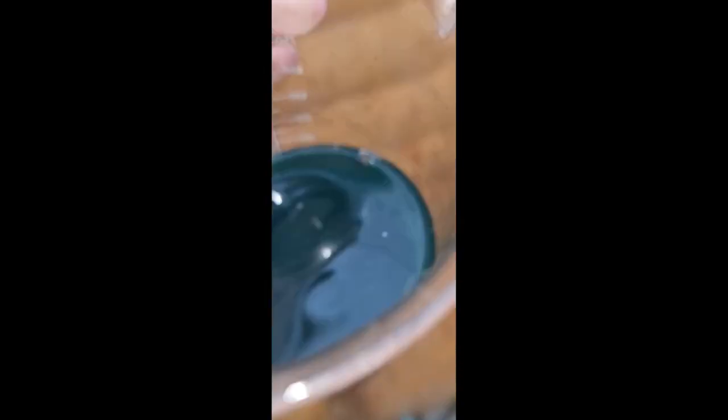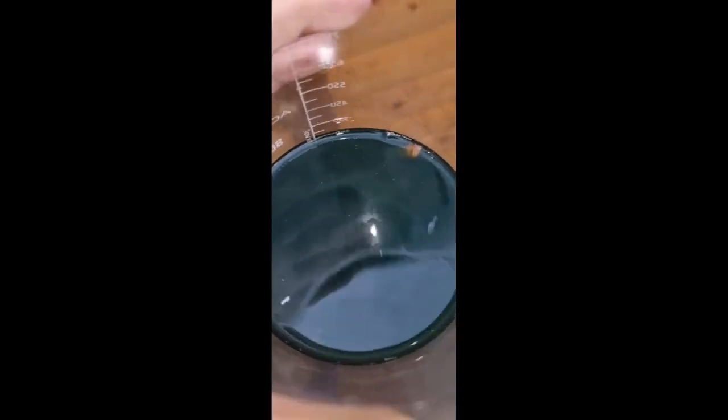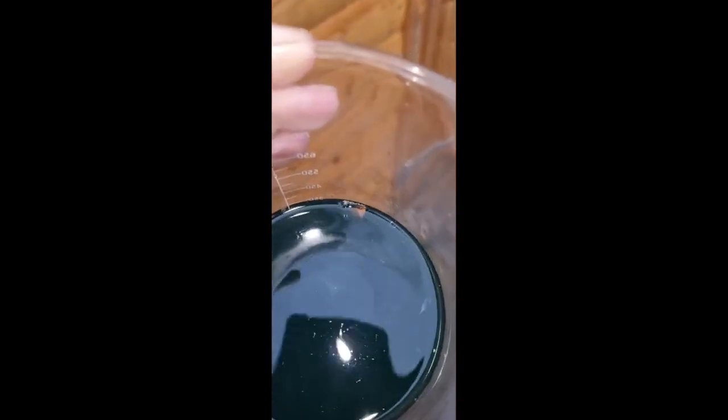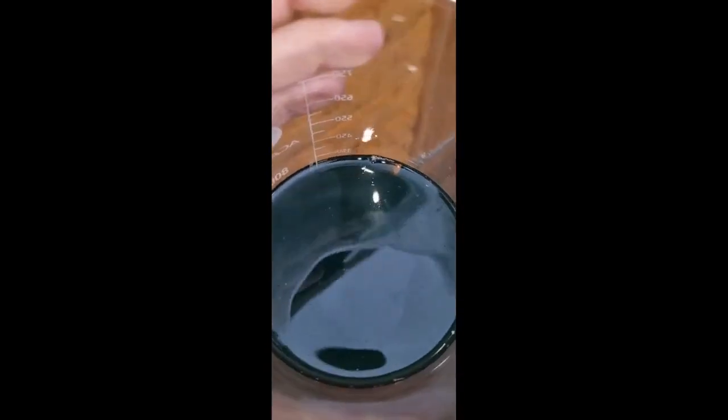So I've now had it in acid overnight just to remove all the copper and any tin in case there was any. I'll just pour the water off, decant it off and carry on decanting more water until there's less plastic left.